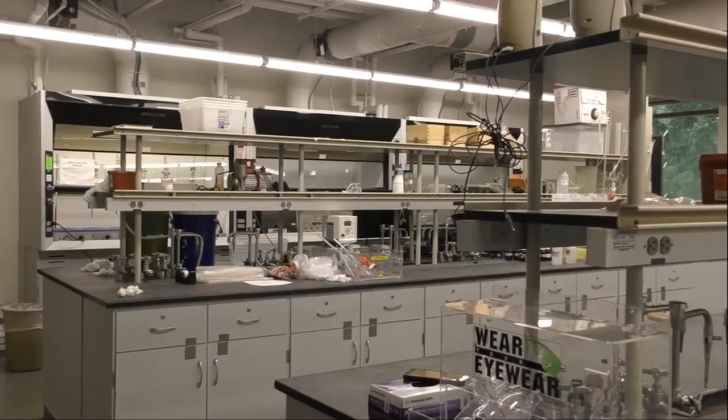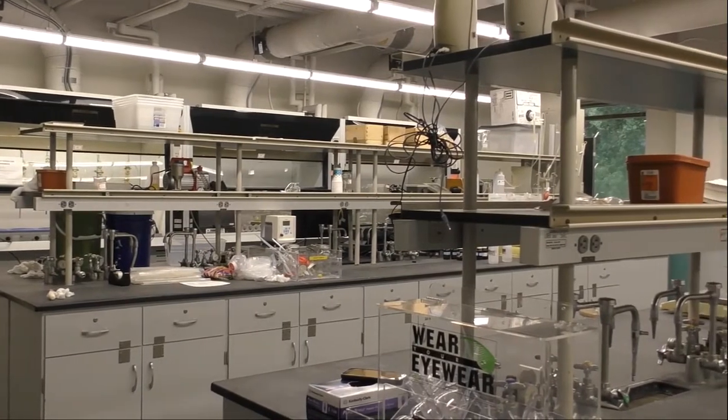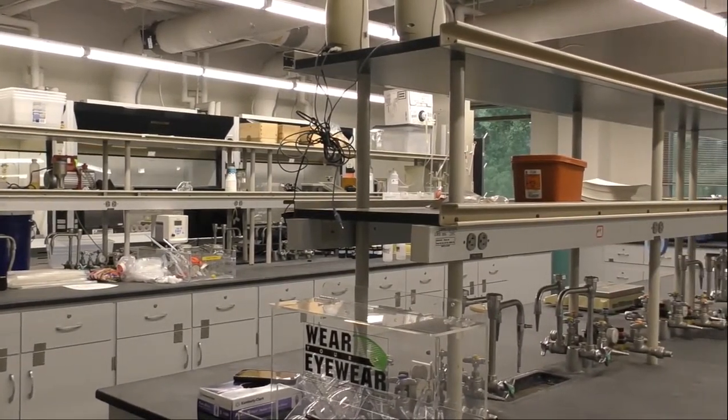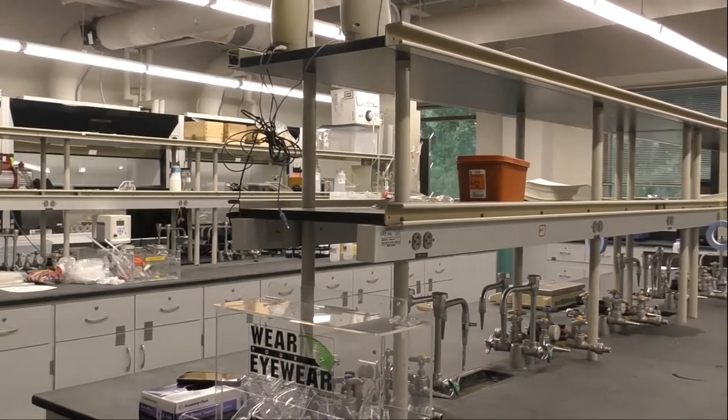Today we are in the chemistry lab of the Forest Biomaterials Department and we are going to perform our deinking process experiment right here.